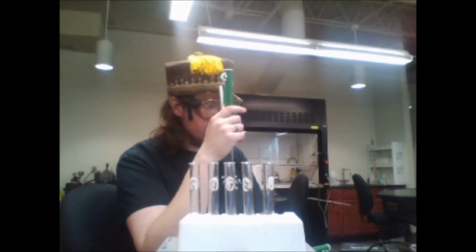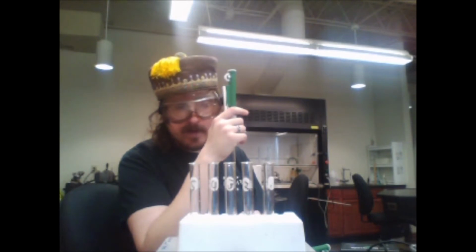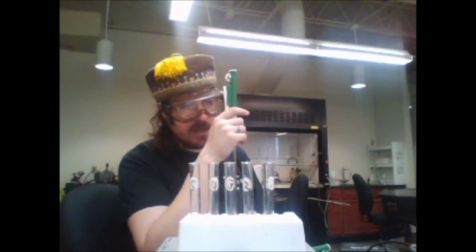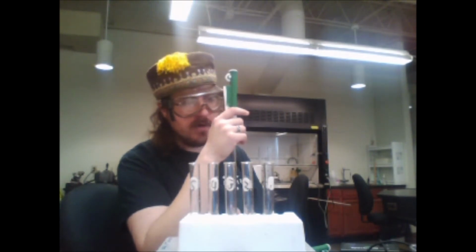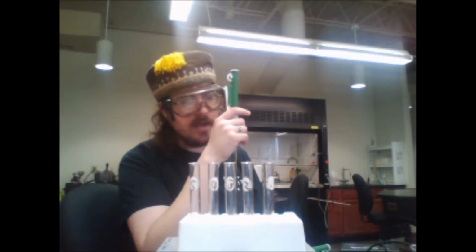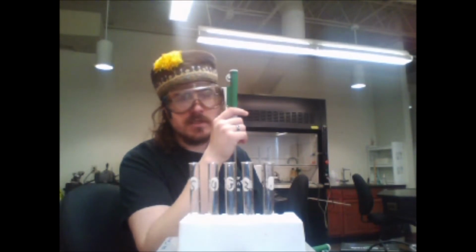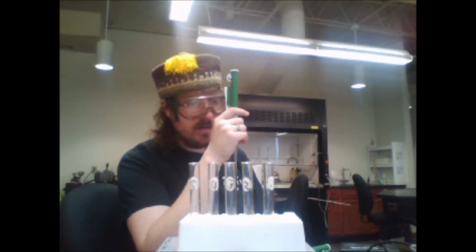This part is we're making our solution of iron thiocyanate for our calibration curve. We're going to make 5 test tubes, each with differing amounts of dilute iron, such that KSCN is in such high concentration that iron is definitely the limiting reagent, and thus we're going to assume this goes to completion much like a strong acid would. The amount of iron thiocyanate is going to directly correlate to the amount of iron we've added.